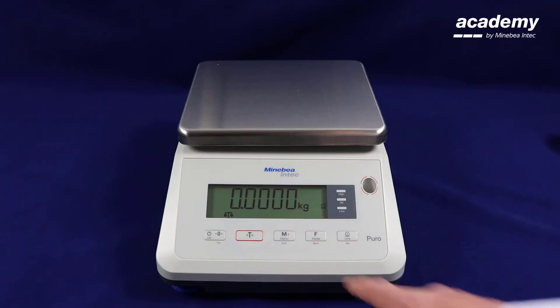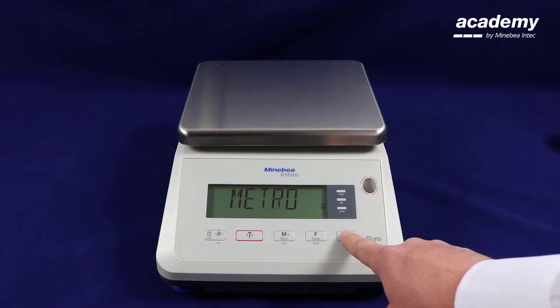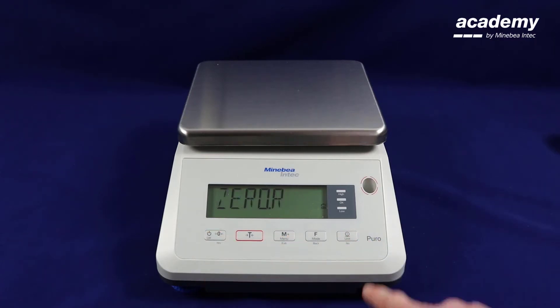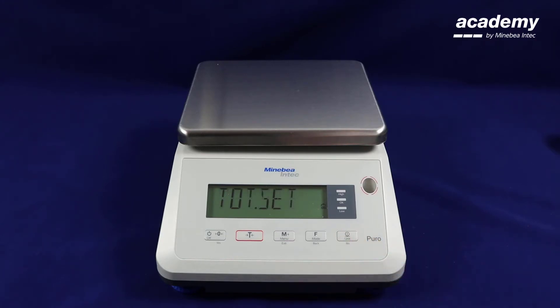This application needs to be activated in the setup menu. Press and hold the menu key. Use the no key to scroll until you see the operation function. Press yes to accept. Scroll again until it displays total set on the screen. Press yes to accept.